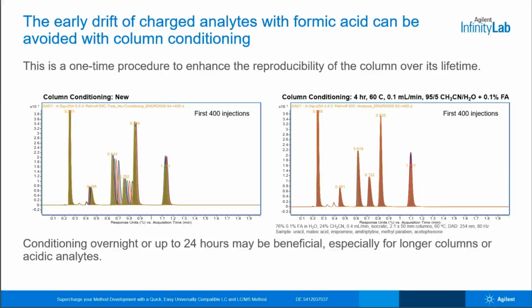If you are curious what that drift looks like chromatographically, here is the data from those same scatter plots. Without conditioning, you can see the acidic peak, peak 2 here, shows a little movement, as well as the next two peaks, which are bases, all while the last two neutral peaks remain pretty stable. And of course, with the conditioned column on the right, retention times are very reproducible from the start.